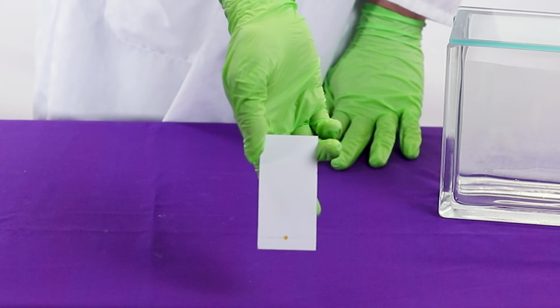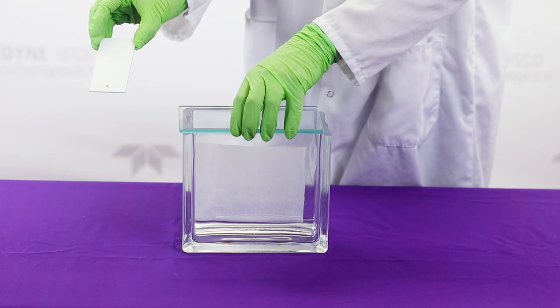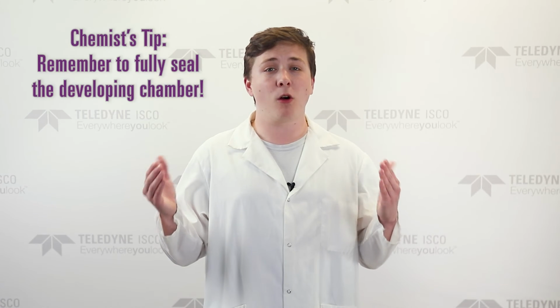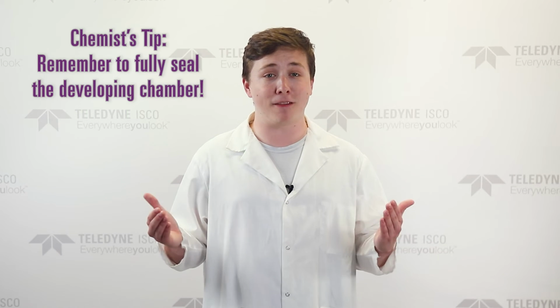Once you have completely prepared your glass plate for TLC, the solvent should have had enough time to saturate the developing chamber. Next, we will remove the lid, place our glass plate in the solvent, and close the lid, making sure one more time to fully seal off the developing chamber. The only remaining step is to wait.